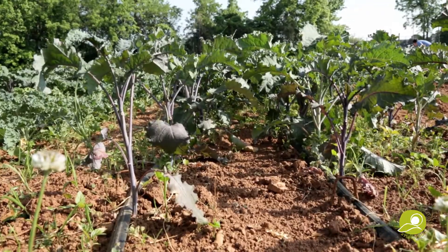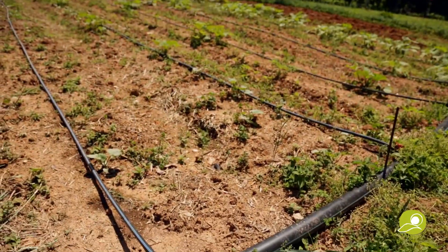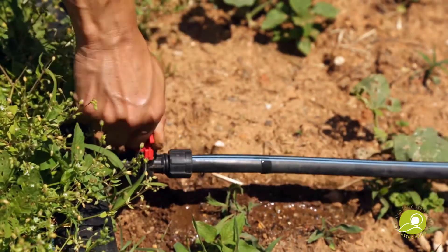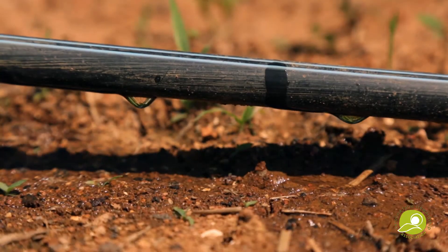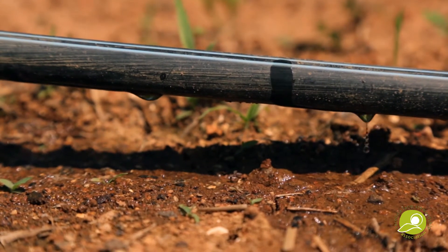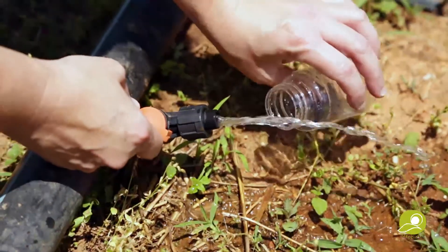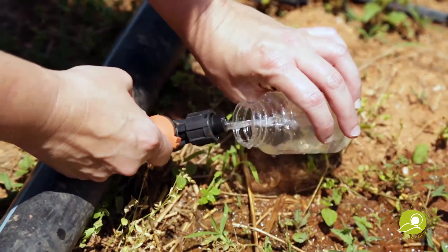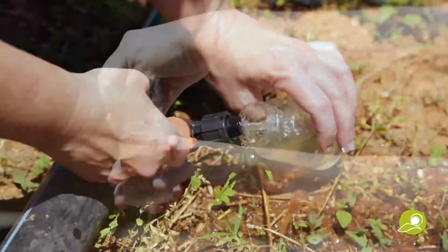When collecting samples at the drip end of your irrigation lines, run the water to fully flush the system. The irrigation line should be running at full capacity. Then take a sample at the sprinkler or drip end. This sample will represent the water at the end point of your water distribution.